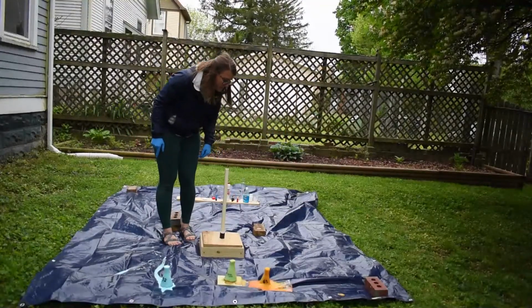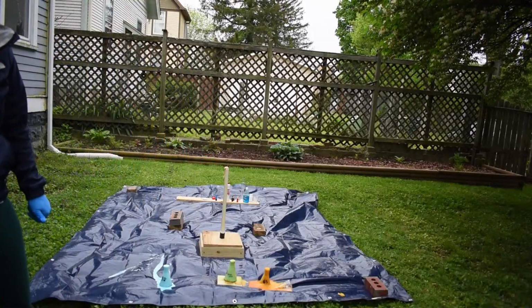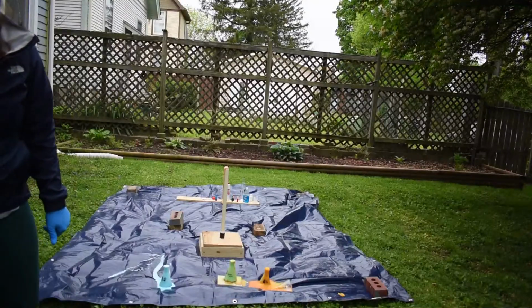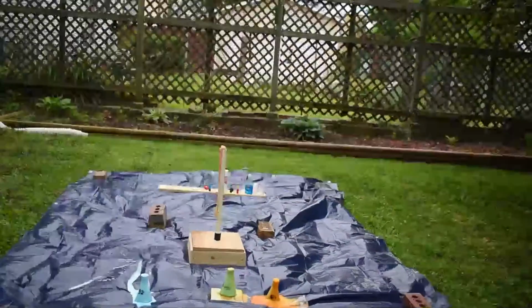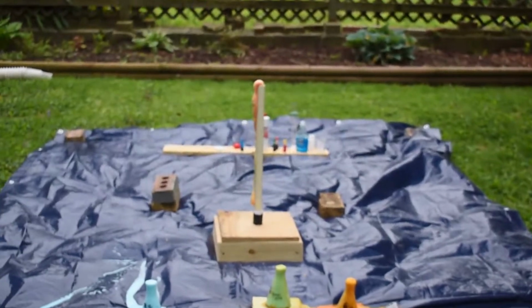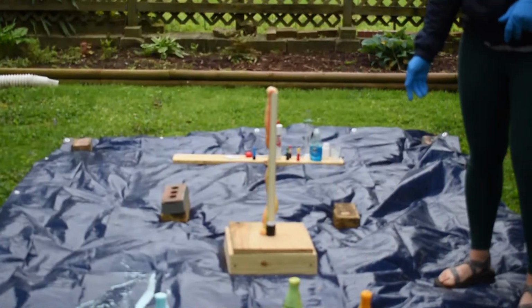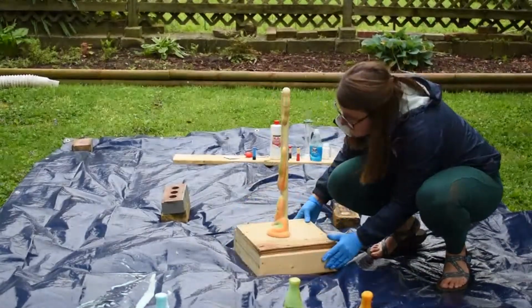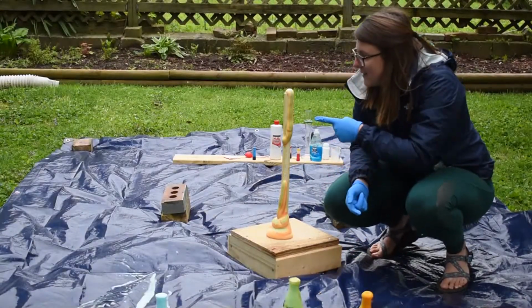Oh, it's starting to come up. I don't know if it's going to quite explode the way that I was thinking it would, but we'll zoom in there so you can see. It's two different colors. See this side. Someone's turning around so they can see the colors. There we go. So we got the toothpaste effect.